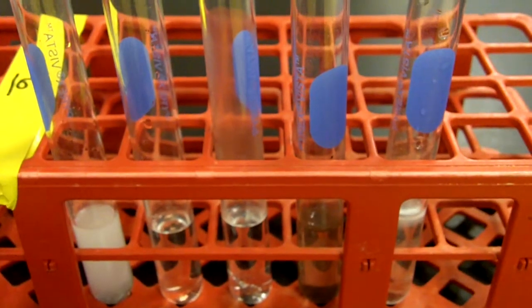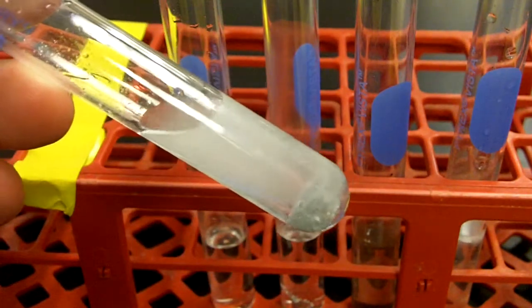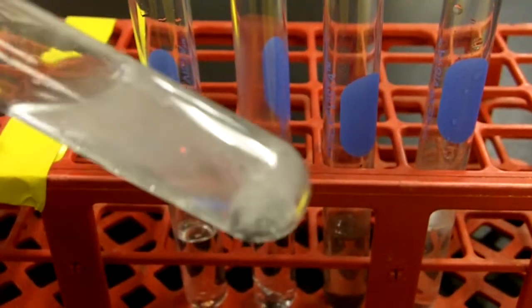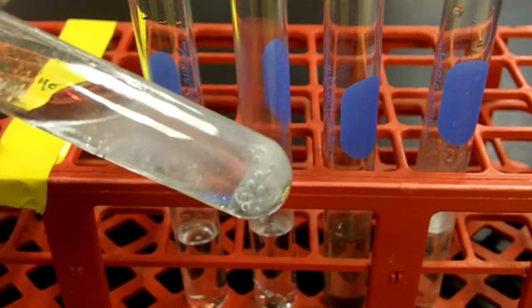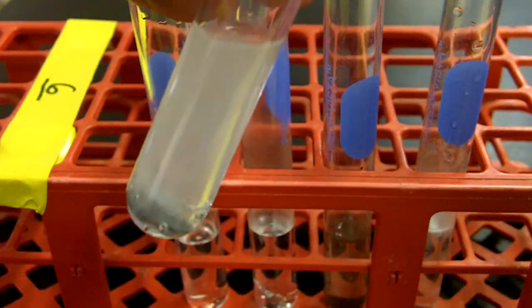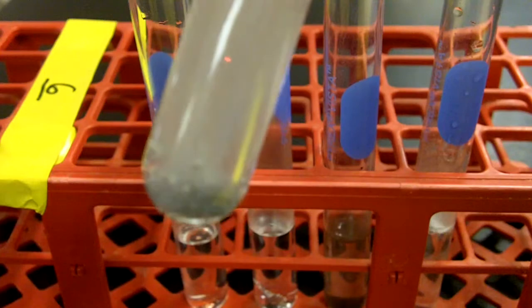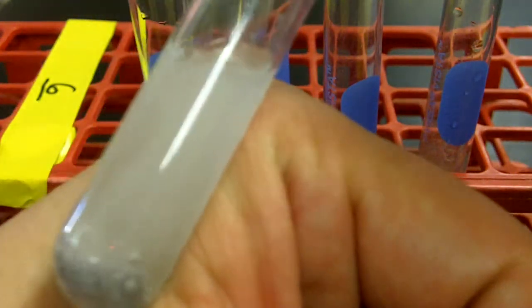Then let's see what's going on with the metal samples. Well, the first one was our zinc. And we can see with the zinc that we have bubbling occurring in the reaction itself. Trying to get a good level of focus, here you can see the bubbles that are clinging to that zinc metal, and those bubbles are actually floating up a little bit. So we have a pretty strong reaction here. We definitely see those bubbles. So please record bubbles under your observations for the Zn. We also want to see if there's any heat evolving.